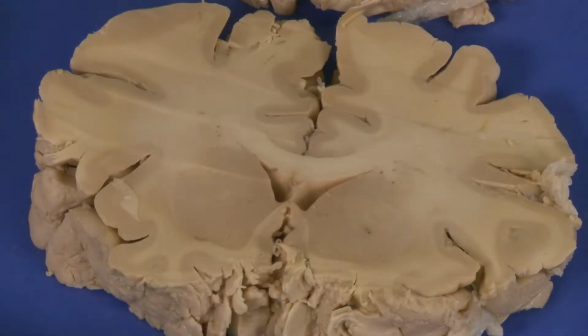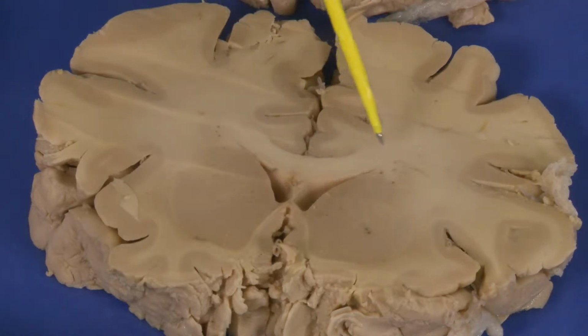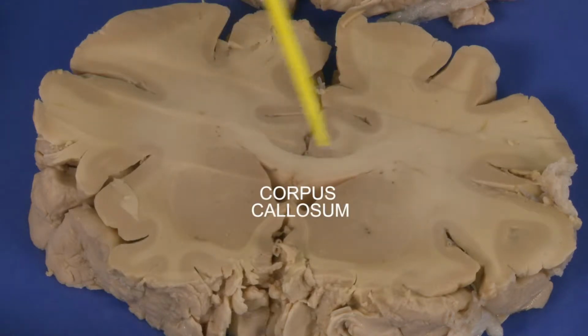Now we are looking at the third section I made through the frontal lobe. In this section you can see basal ganglia. Basal ganglia are a group of neurons with mostly motor functions. At this level, first we can see the longitudinal fissure, which divides the left and right hemisphere. You can see a very well formed corpus callosum, that is white matter that connects two hemispheres.